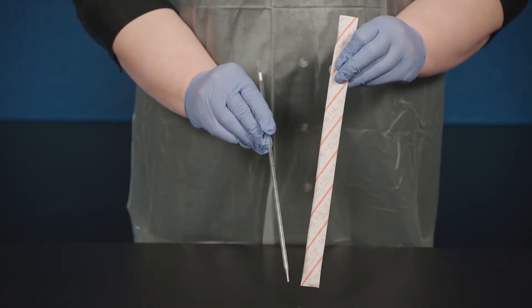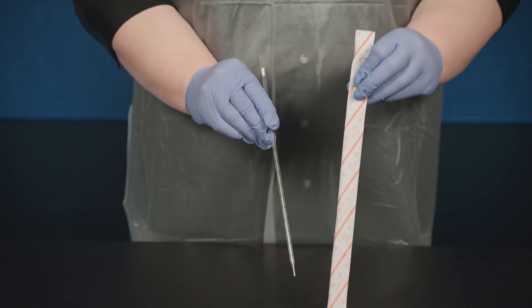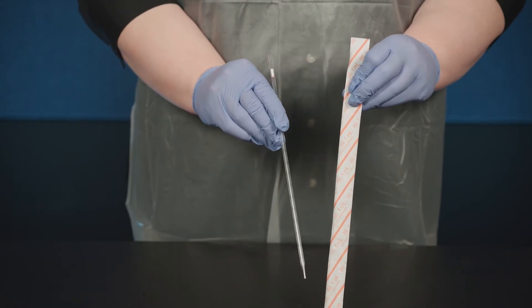Because serological pipettes are often used to transfer liquids that need to be kept sterile, they're commonly provided in special packaging to keep them sterile.